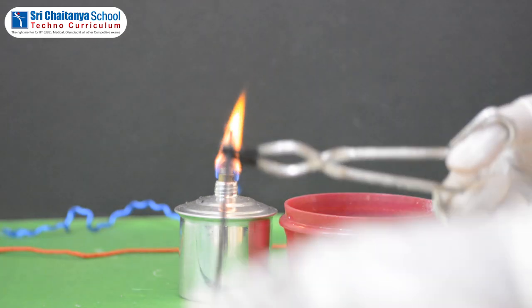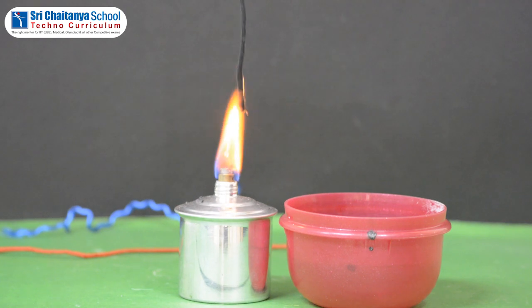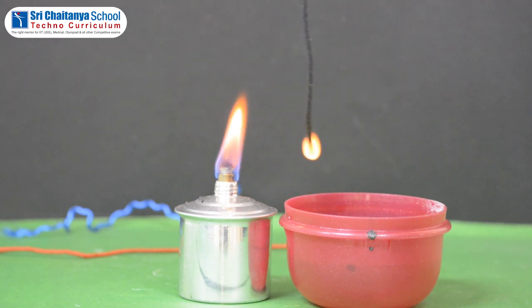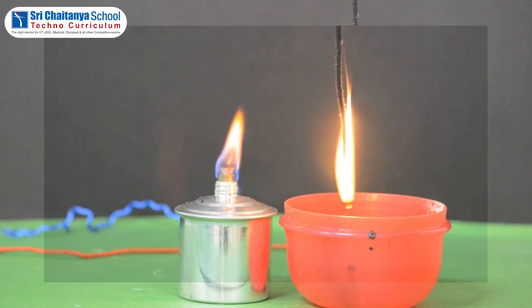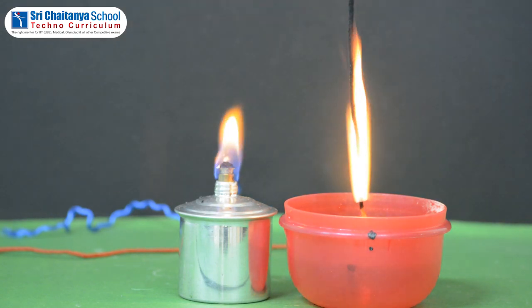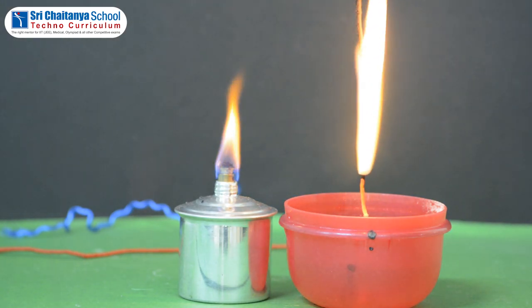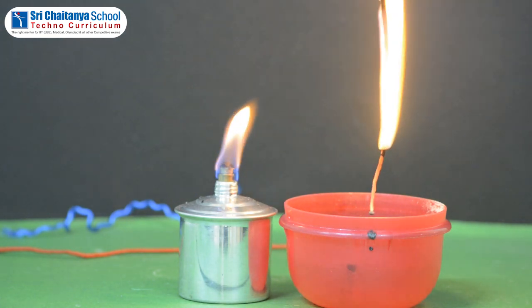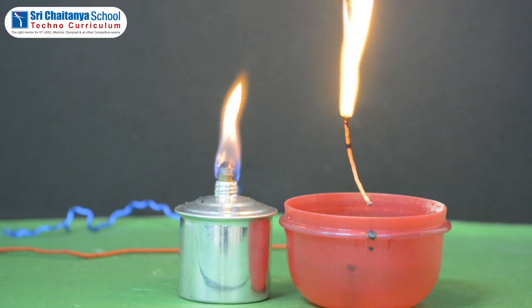Next, hold a small piece of cotton with tongs and burn its one end with a spirit lamp. Check the following: how does the fabric catch fire, and the smell after burning. Record your observations in the table.